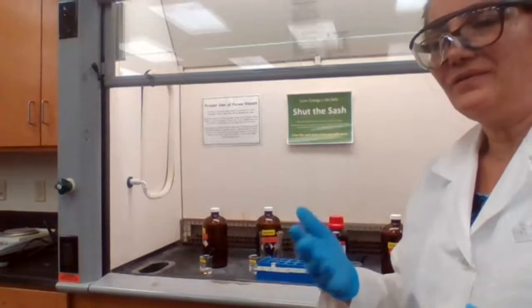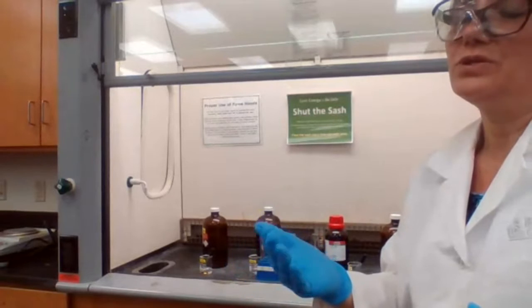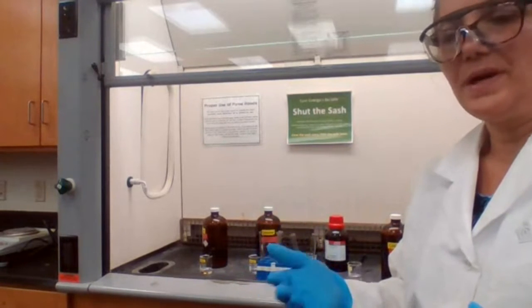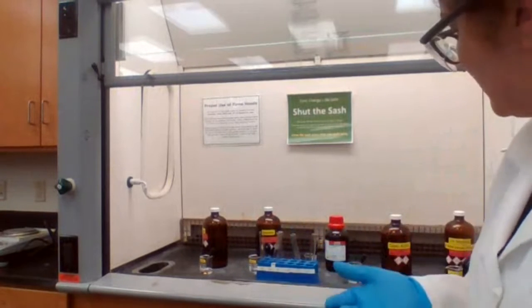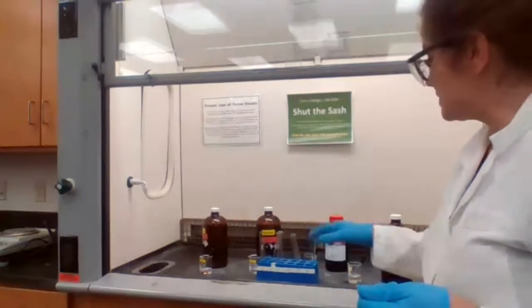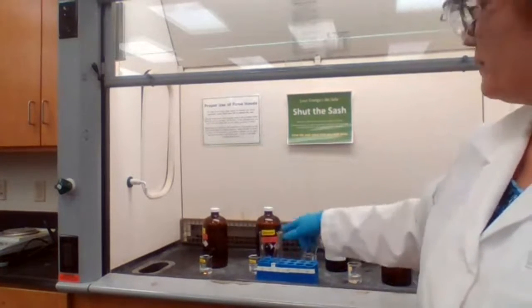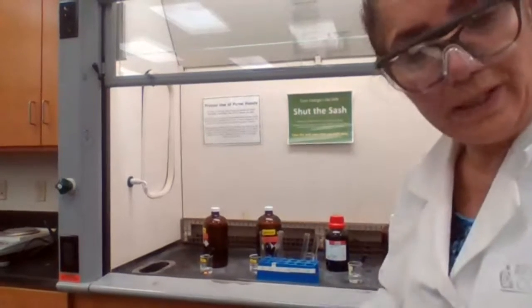So a positive test with bromine solution means that your compound is unsaturated. You can use that also for the unknown solutions. So we are going to test each of the hydrocarbons that we have again, this time with the bromine solution.